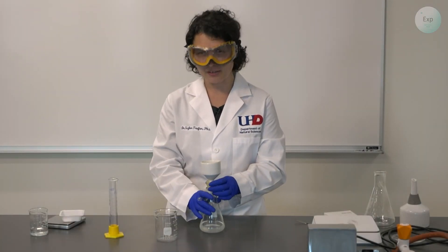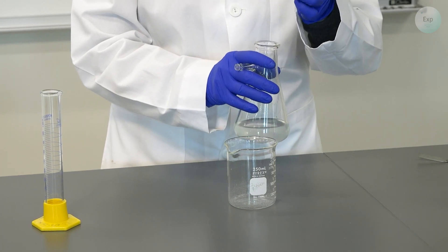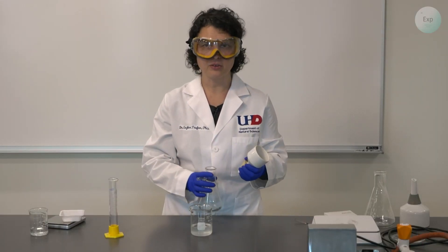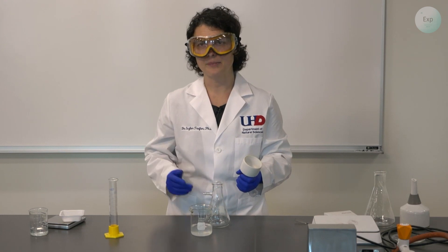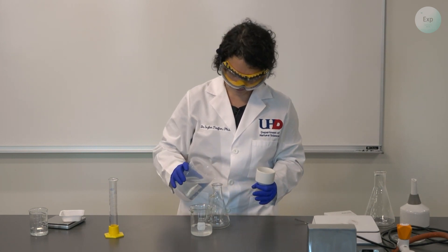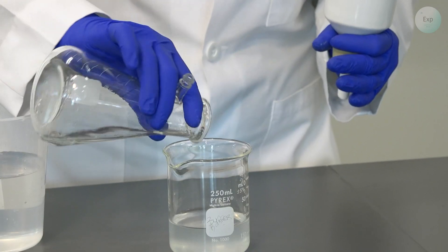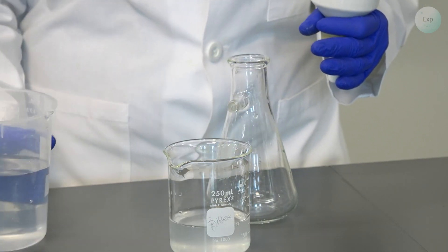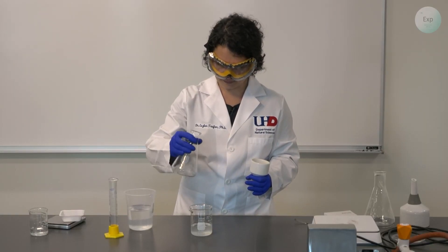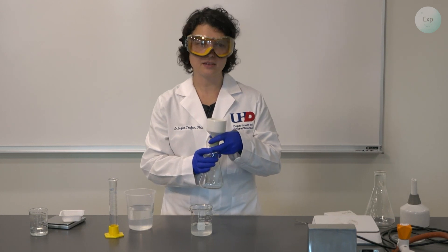For the first step we need to transfer our calcium chloride solution into the 250 milliliter beaker. So we remove the used funnel and transfer the solution in. You can always use the same funnel but between filtrations you need to clean them thoroughly. Next we're going to add a very small amount of deionized water, swirl it really well, and transfer it over. We do this at least one more time, and with that we are done with the original flask.